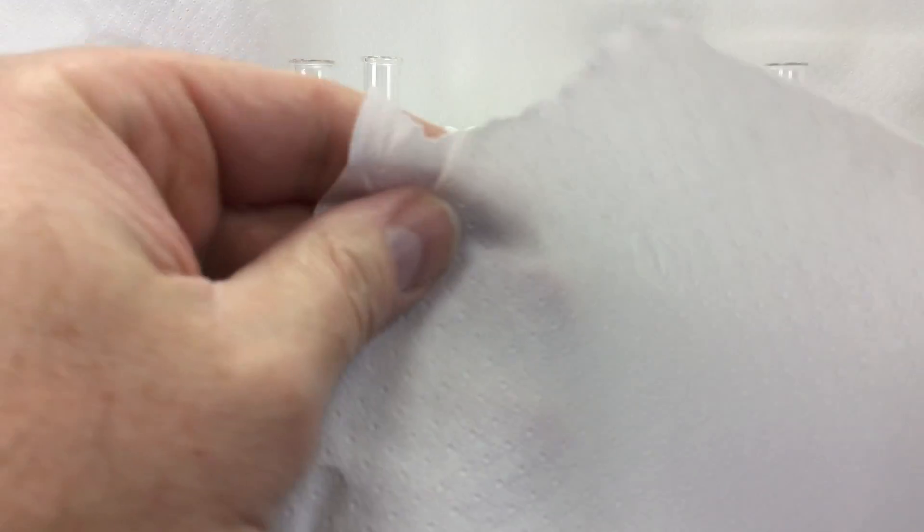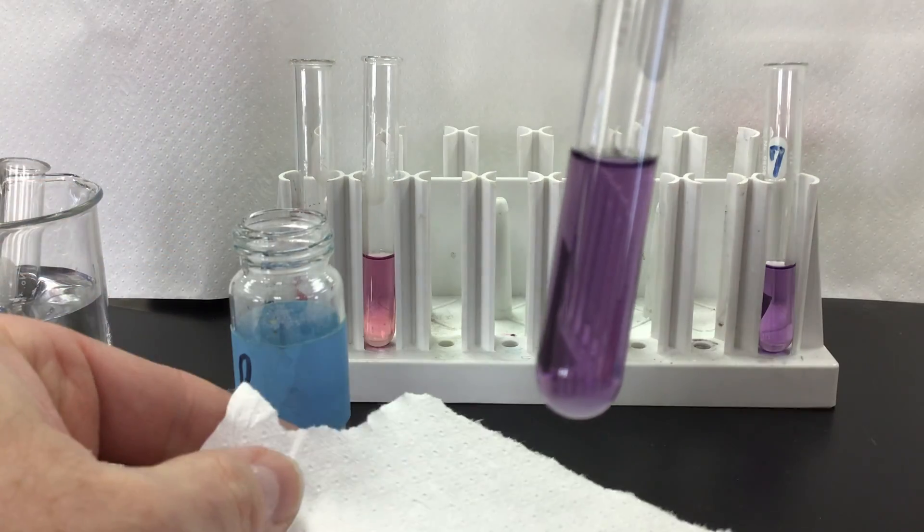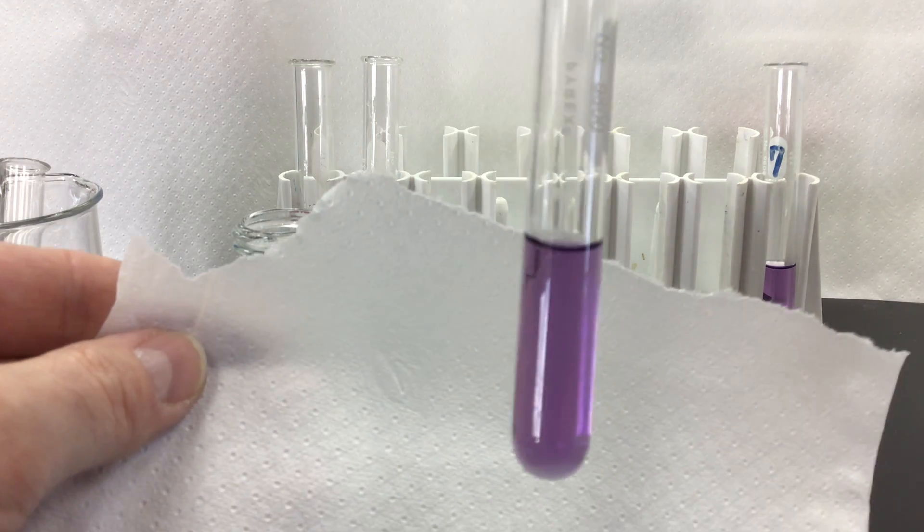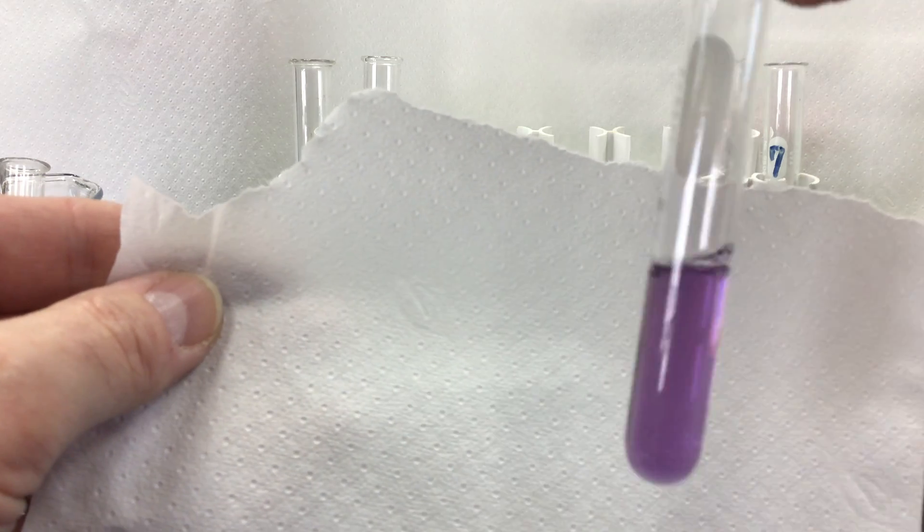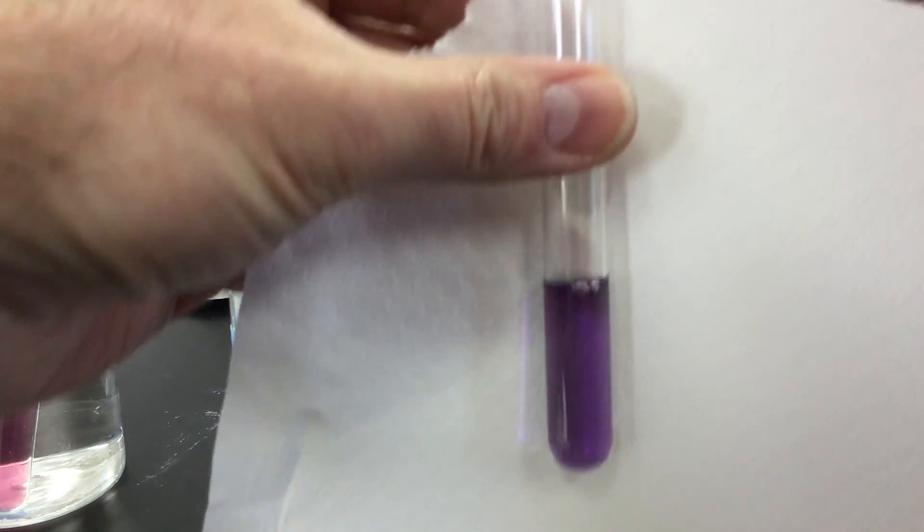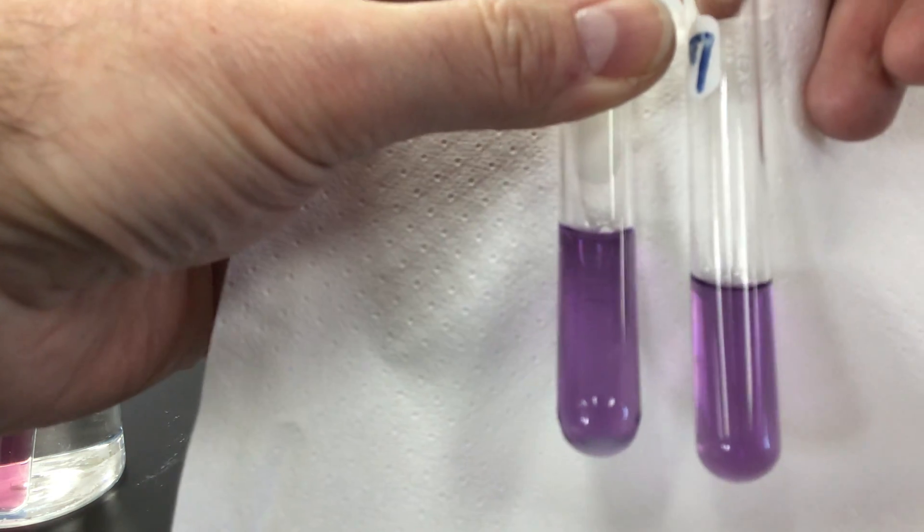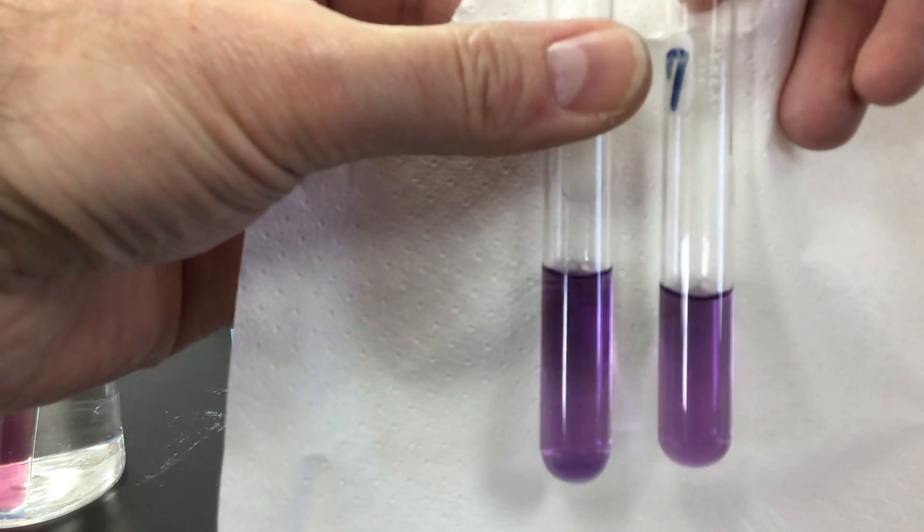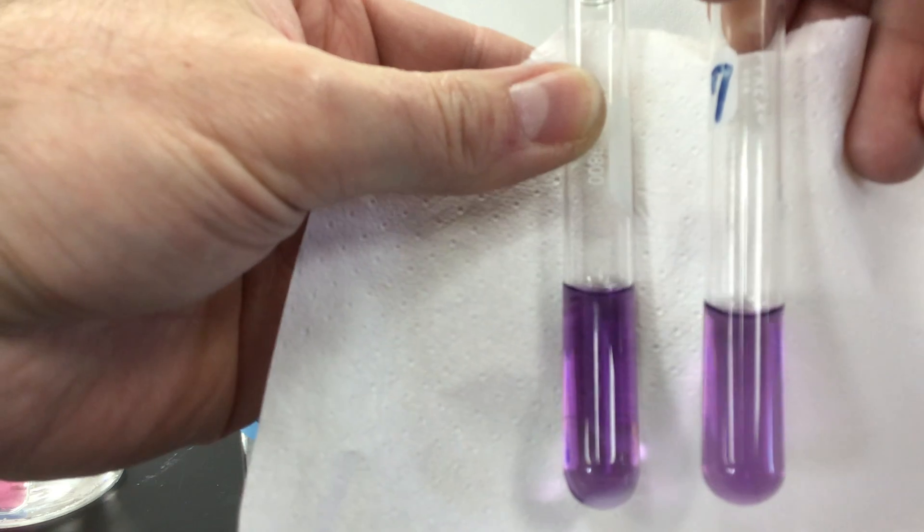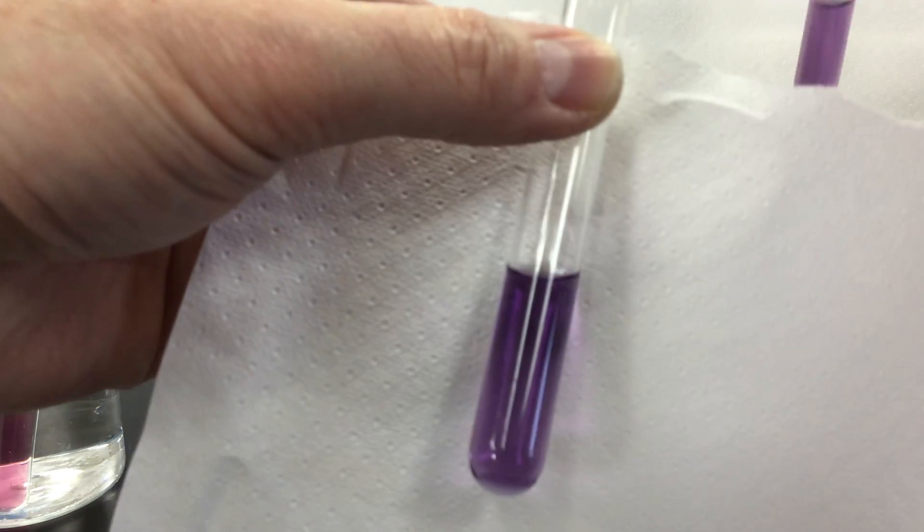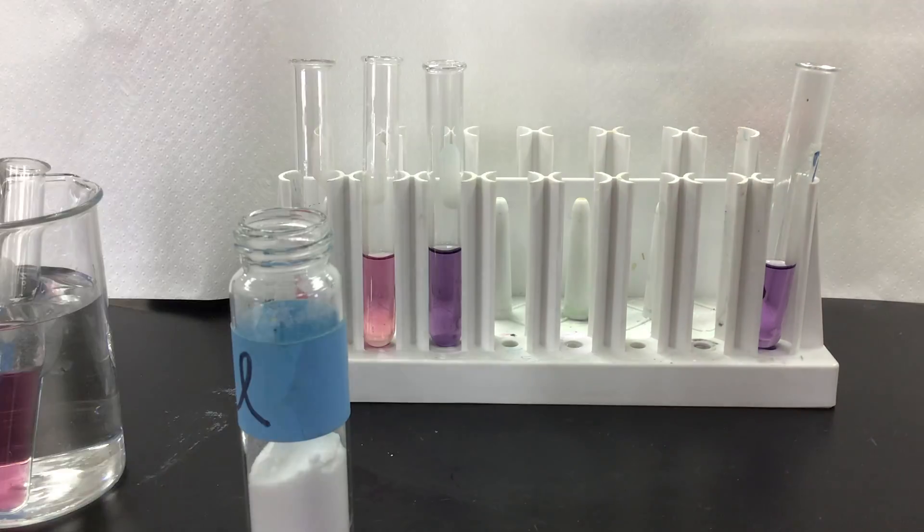Let's kind of go up in front and see if we see anything. Any kind of change that's happening. It doesn't appear to be really much of a change at all, if any. I'll take another one we haven't used, put it next to it. They pretty much look the same color. Kind of depends on a little bit of the lighting. It doesn't look to be much of a change in color. Sometimes hard to tell with the lighting in the room. So I'm not noticing much of a change there.